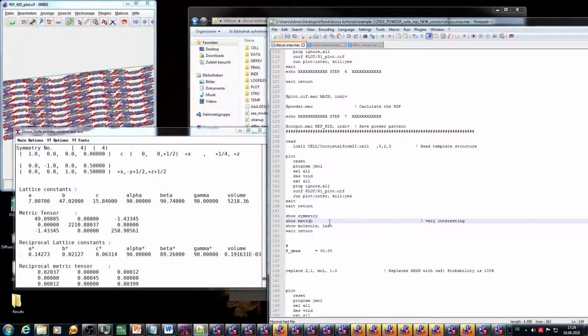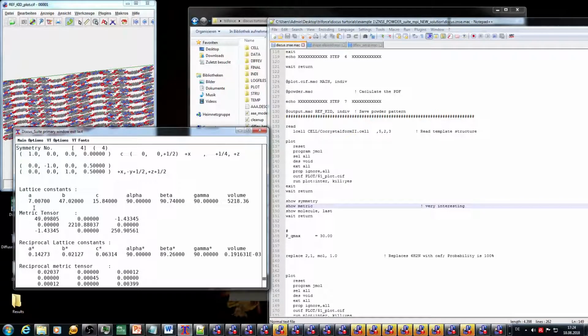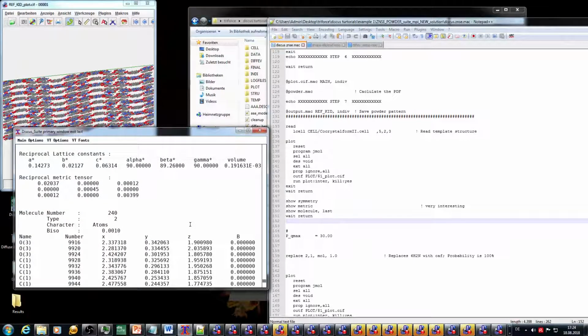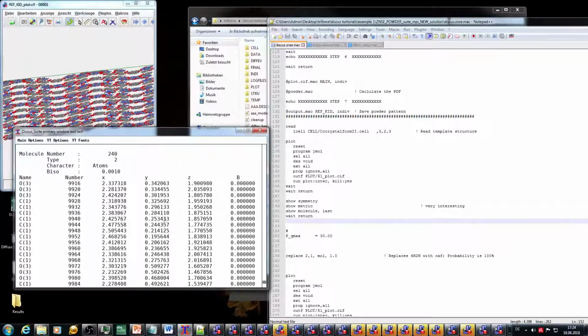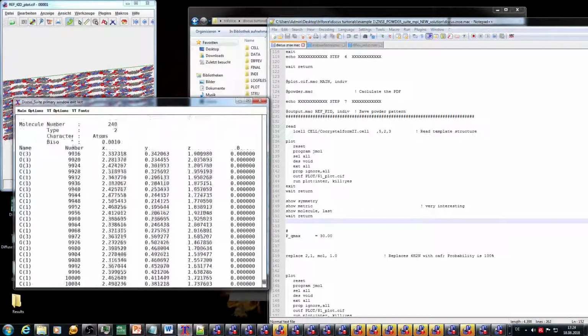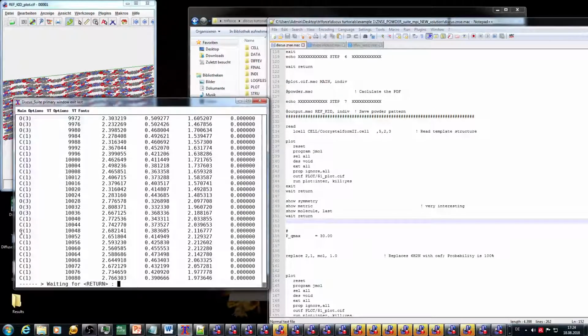Secondly, Discus gives out the metric, which is pretty much the lattice constants or parameters to be more exact, with A, B, C, alpha, beta, gamma, the volume of the unit cell, and the metric tensor. Lastly, we have the show molecule last. So it just points you to this window, the last molecule, and I have defined actually three molecules, so three acid molecules pretty much into one molecule. So these are the atom coordinates, number, atom coordinates, B-value of this atom, okay, and with oxygens and carbons. So, and the idea is now to replace these acid molecules by caffeine. That's what I've done here.